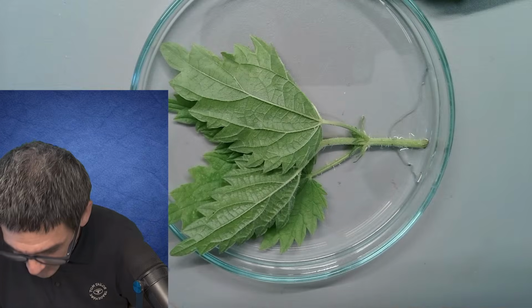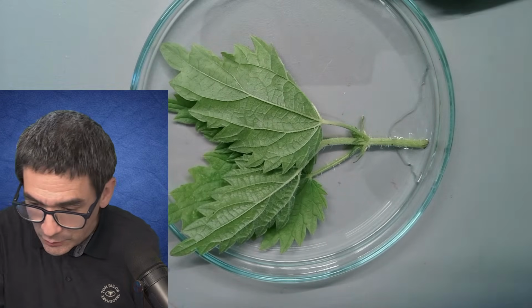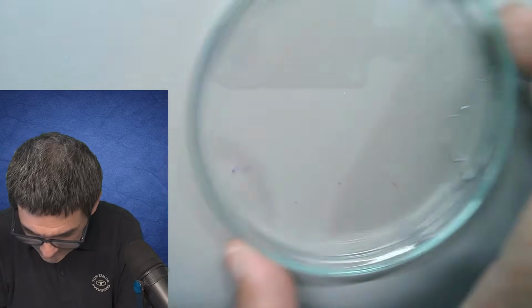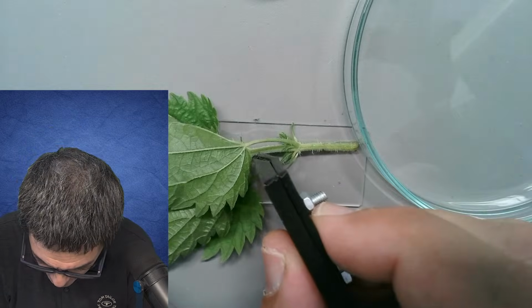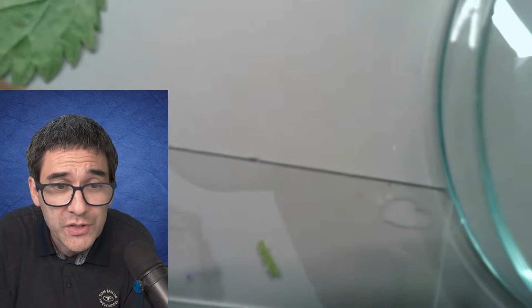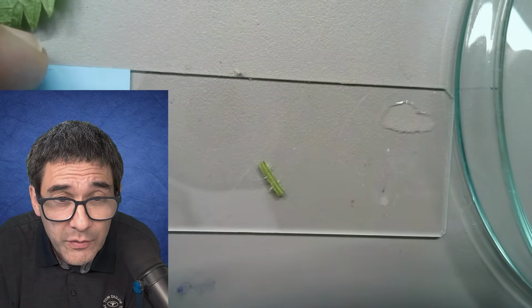How am I supposed to cut this off here? Those tiny things here. I have really no idea. So what I'm going to try to do is grab it here. Do the easy way first. I'm just going to take part of the stem here first. Another question is how am I supposed to just get the, I have really, folks, I have really no idea. Okay, but you see over here the very fine spikes.